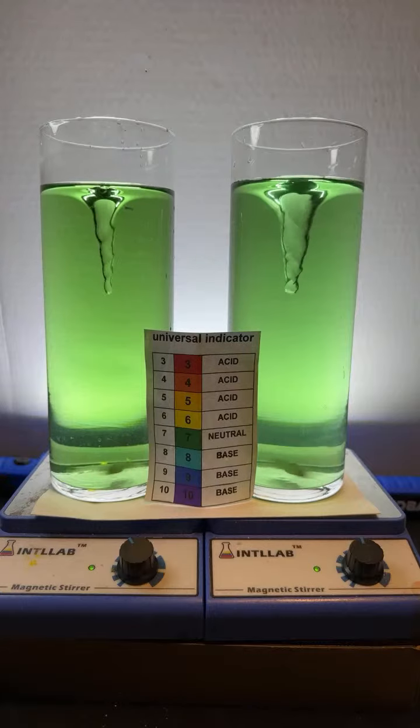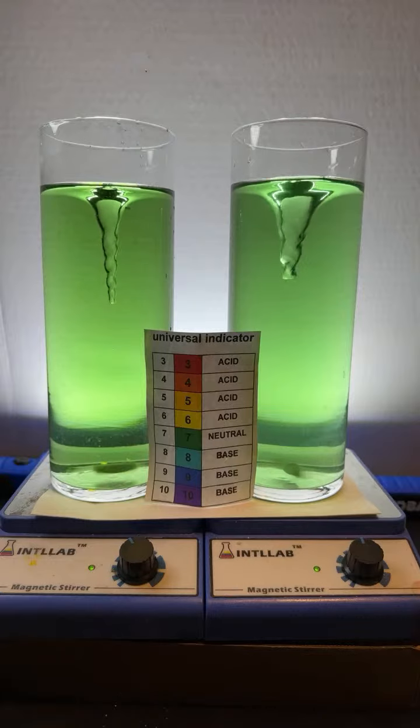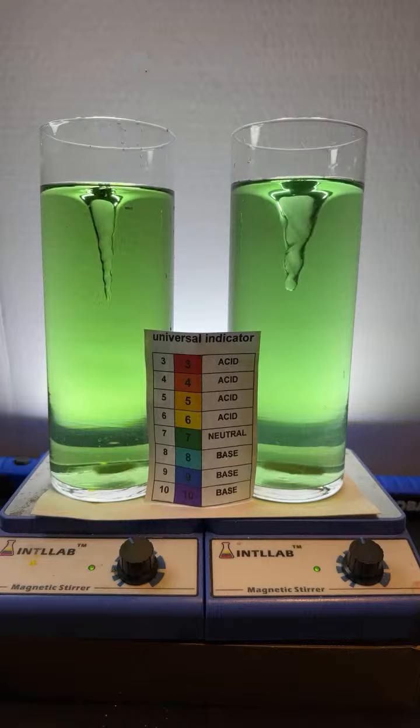All right, where in the world? I'm running out of acid. I got to replenish here. And I've got a funnel somewhere that helps me. There it is. Okay, you got to forgive me here for a second. I've got two neutral solutions, but I've got to replenish my acid bottle here.